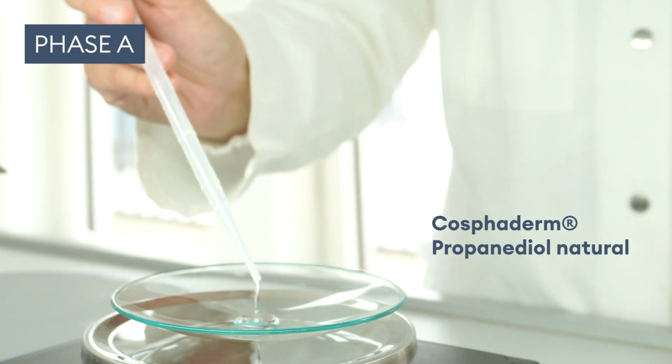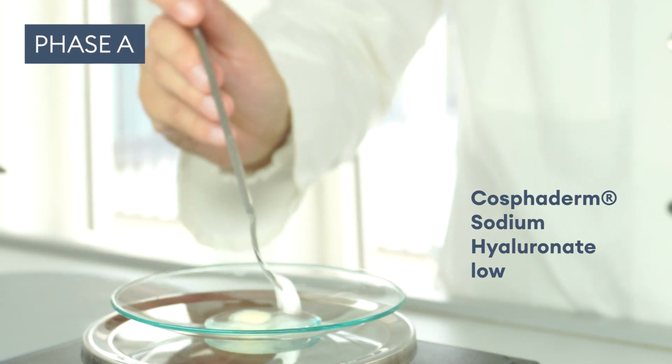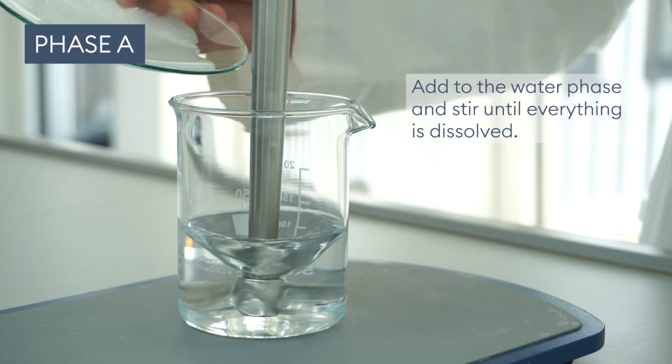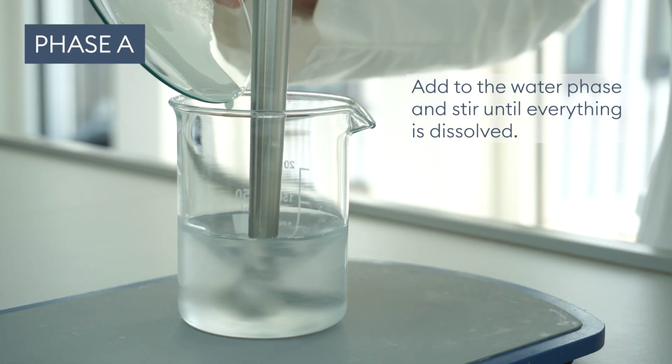First we combine Cosphaderm propanediol natural, Cosphaderm X soft, Cosphaderm sodium hyaluronate low. Then add it to the water phase and stir until all the ingredients have completely dissolved.